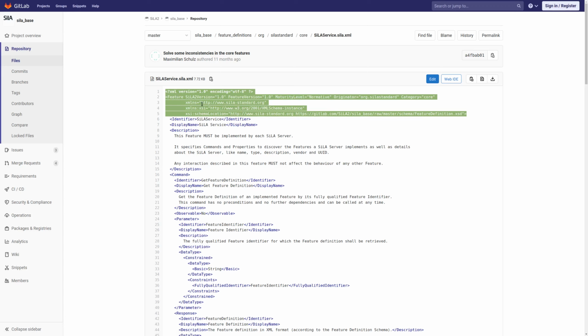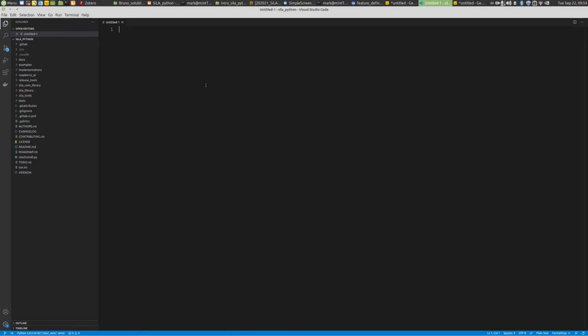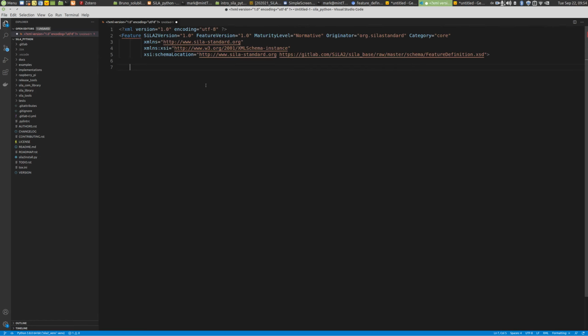Copy it, and to develop a feature, I would highly recommend using an intelligent IDE like PyCharm, IntelliJ, or Visual Studio Code, because they highly support you with the development of such XML files, as I can show you in a second. So let's just open such an IDE. This is now Visual Studio Code, and I'm pasting the head of this XML file into my editor.